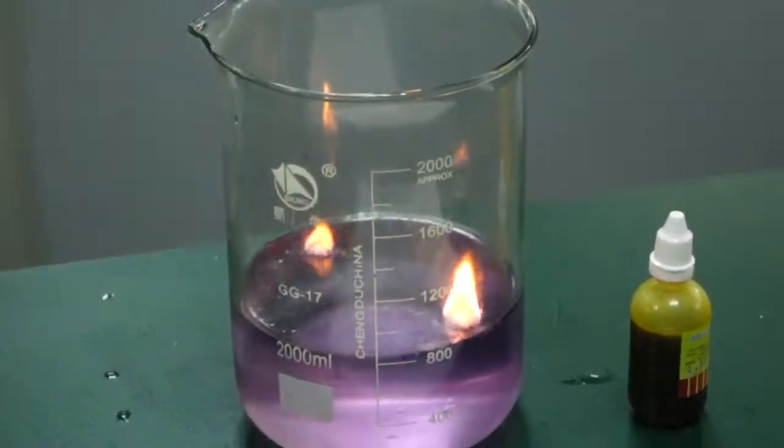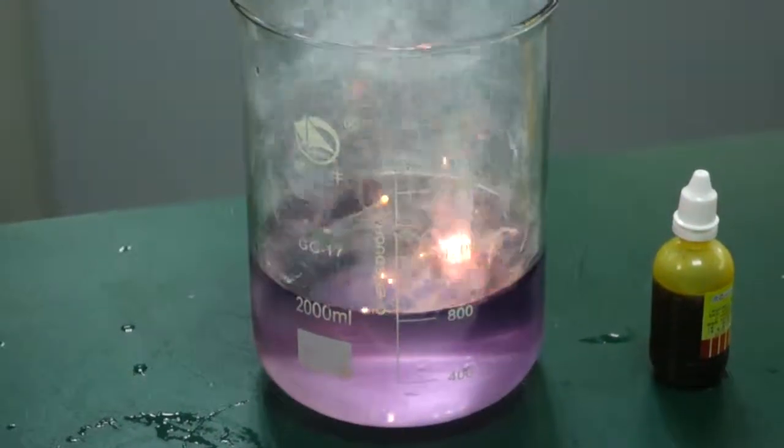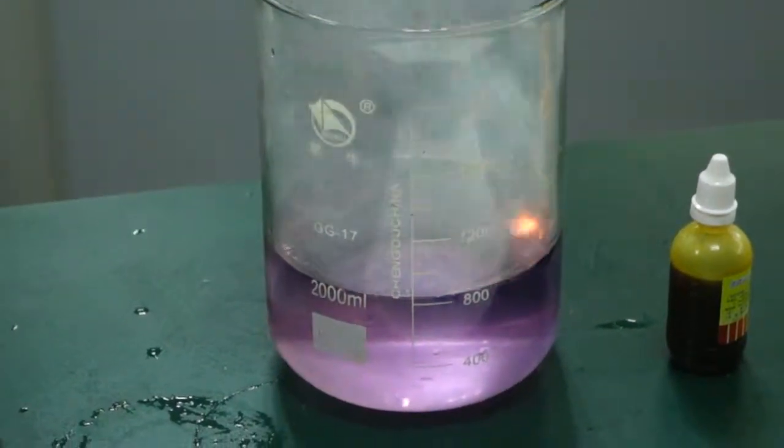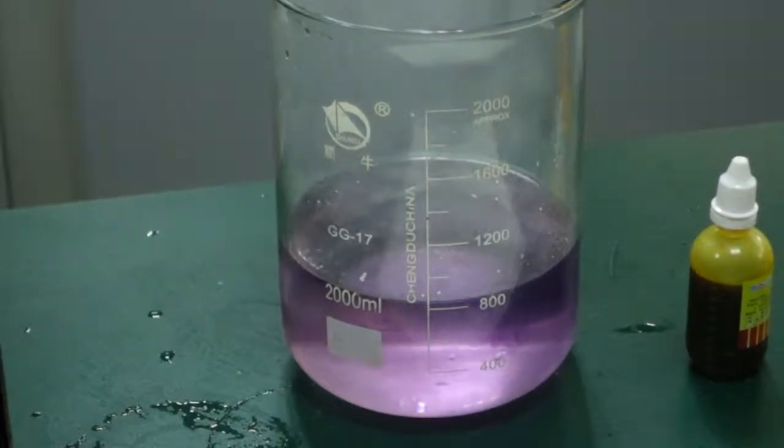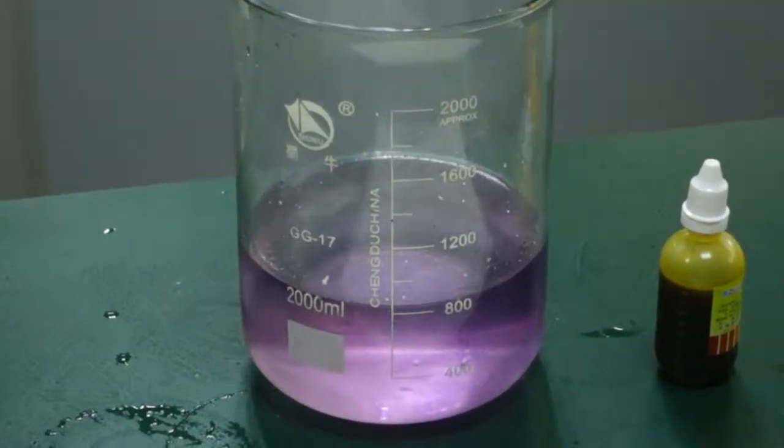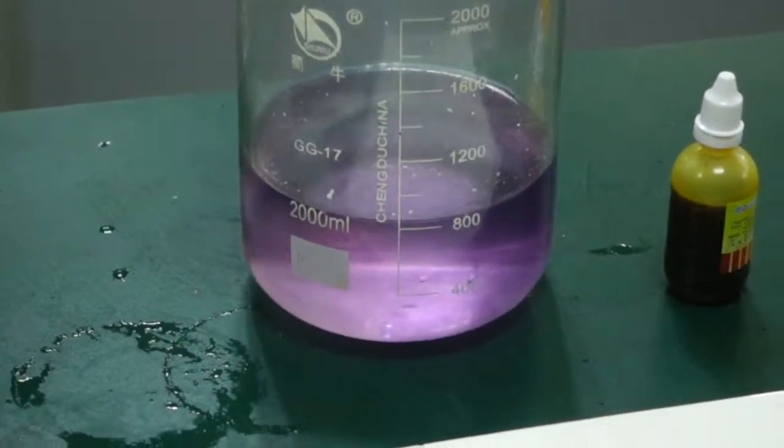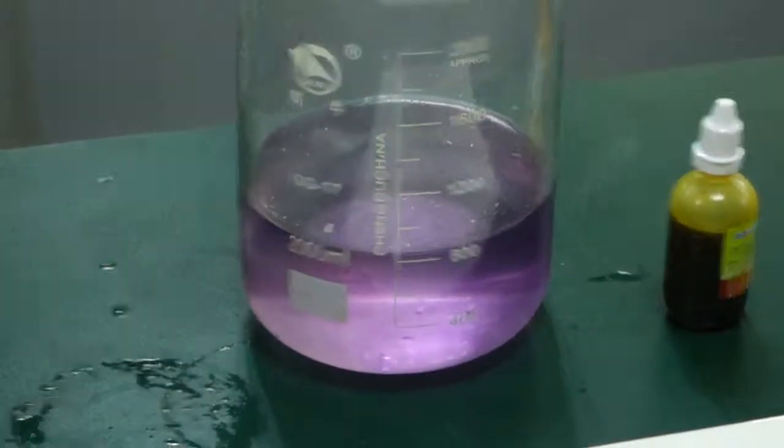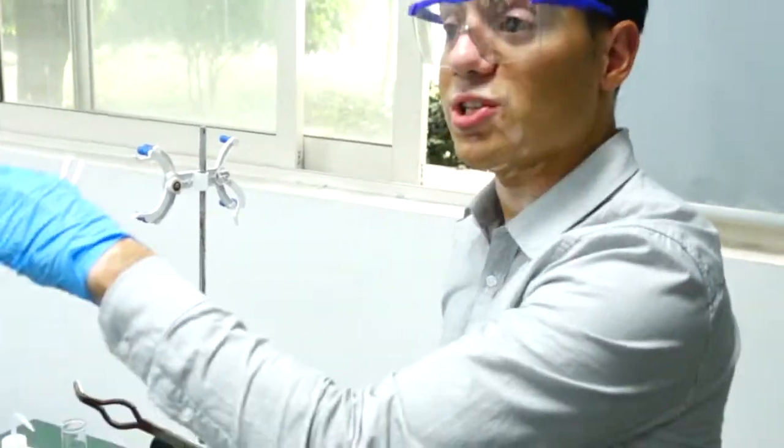Whoa! That is melting metal - those sparks you can see, melting metal, molten metal! Nice. So that's metal Y. Don't forget to write down what you saw. The color of the flame is important, not only the strength of the reaction but also the colors, the sparks you can see, the smoke. Write down everything you've experienced today.